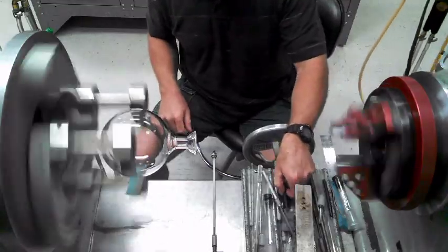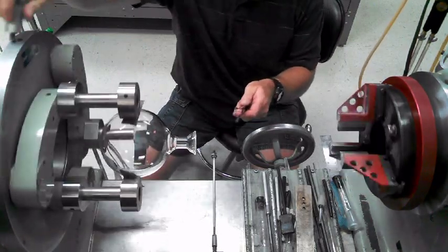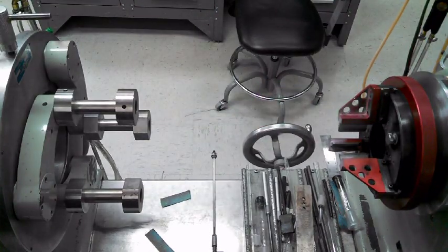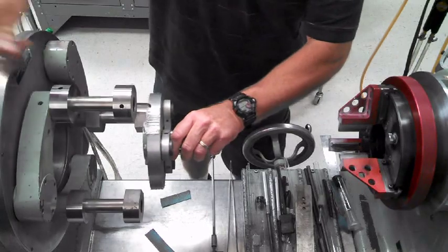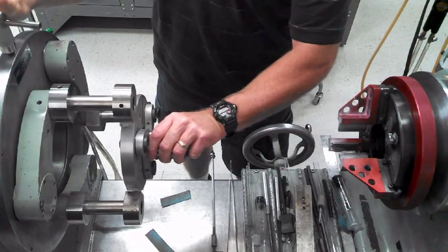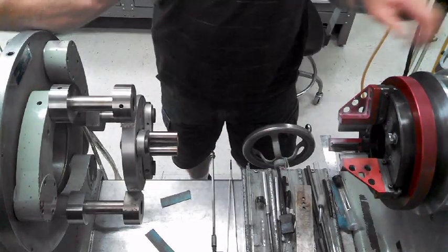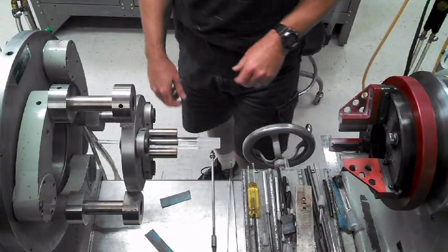So now, let's go ahead and get this out of the oven. I've got one more thing I want to show you. Back in one second. Now to install this back in here, I've got these pieces of sticky felt on one side — come in here and I just basically, like so, line them up, like that. Put that chuck key away. Now I can chuck anything back down to small again. No big deal. Hope you enjoy, thanks.